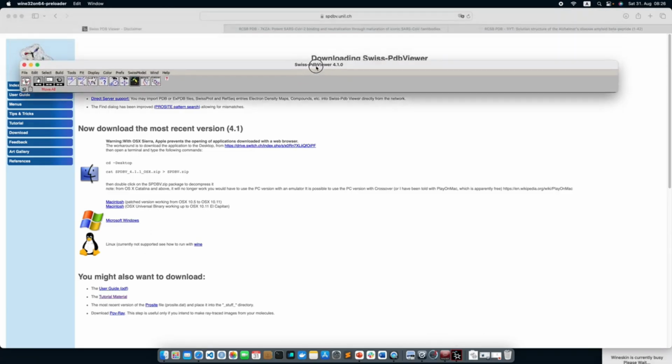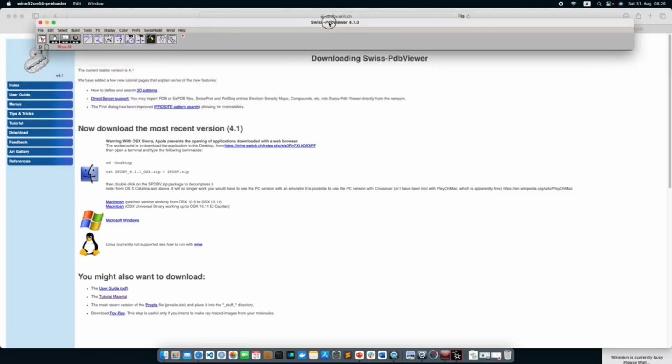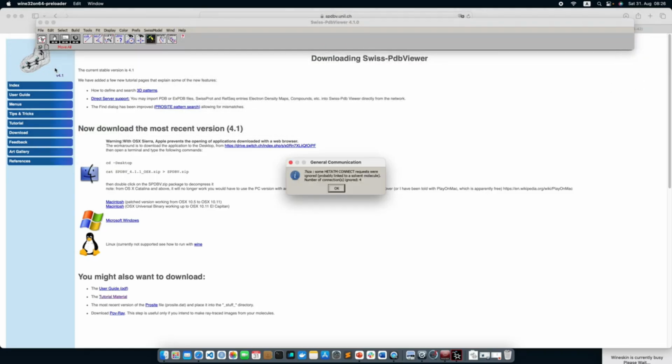When you open Swiss PDB Viewer, this prompt will open up and you go to File, Open PDB file. The first information that will pop up is: some heteroatom connect requests were ignored, probably linked to a solvent molecule. Number of connections ignored, 4. So it automatically detects what kind of errors you get from a PDB file when you download it from the PDB database. Now it will say that some amino acid side chain atoms are missing. A reconstruction of the whole side chain will be attempted. Affected amino acids will appear in pink.